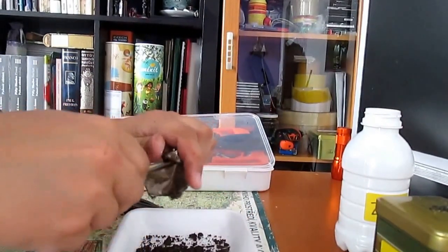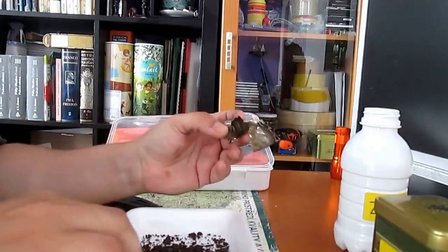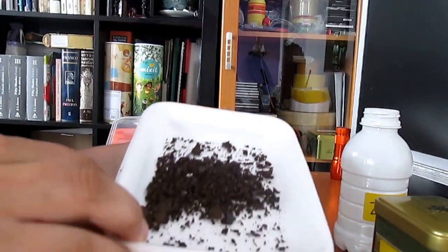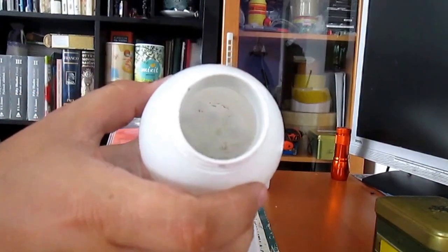Let's see what we have acquired: steel casing, manganese oxide, and zinc oxide in potassium hydroxide paste.